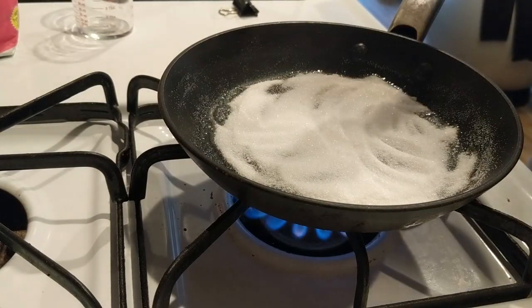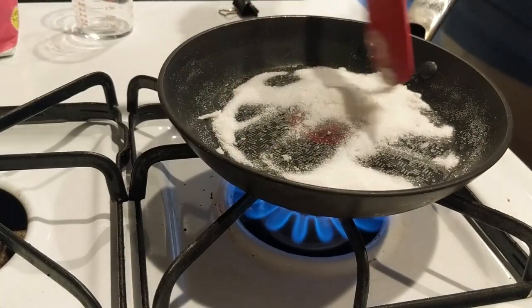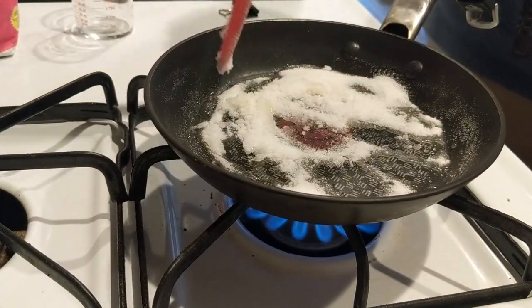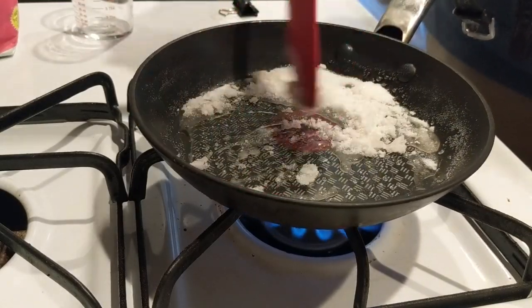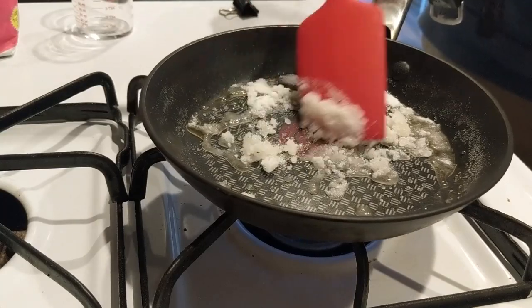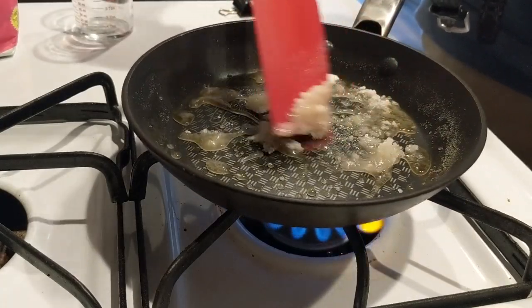All right, we're coming up to 2 minutes. I'm not noticing much of a difference here with sugar. Oh, wait a second. Uh-oh. We got a little bit of melting going on. You could see the melting. Happened right around the 2-minute mark. And you could see how that sugar is starting to become much more of a liquid. So it's been 2.5 minutes now. We'll wait till we get it all liquidy.